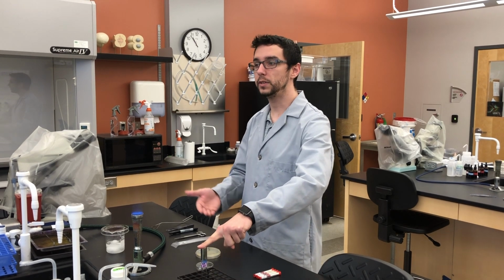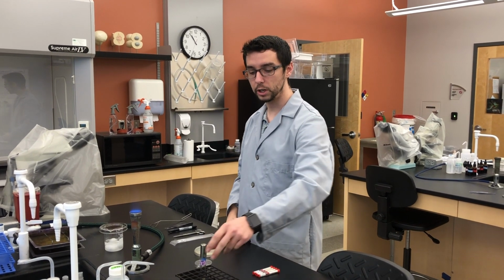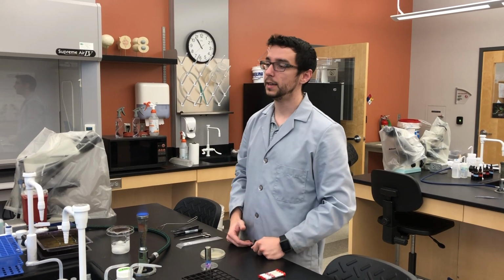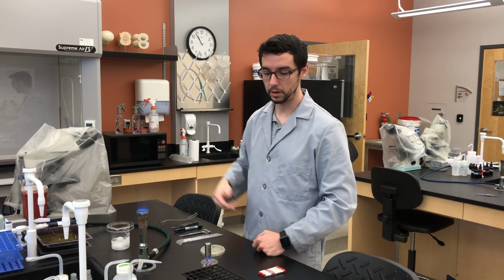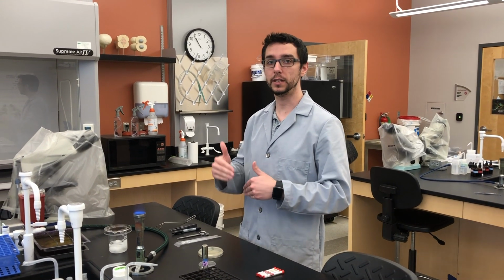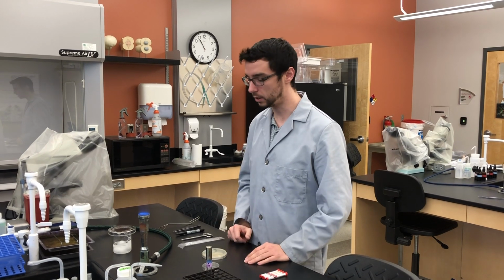The other thing for this activity is that you're going to be working in conjunction with your whole bench, all right? So you and your lab partner are going to be working with one culture of E. coli, for instance, and your other lab bench pair is going to be working with Staphylococcus aureus, all right? But for the most part, you're doing the same activity with the same antibiotics. We're just assessing how these different bacteria respond to the different antibiotics. And you're going to be working together as one whole bench to achieve that goal.